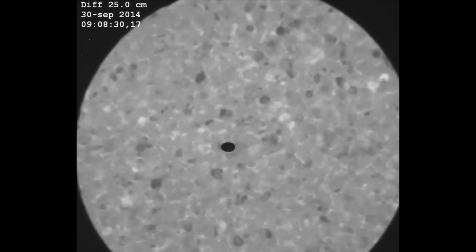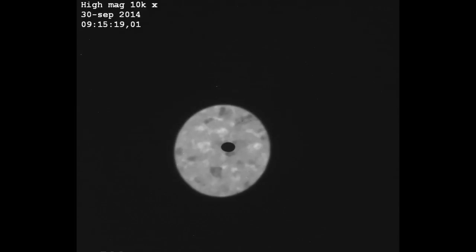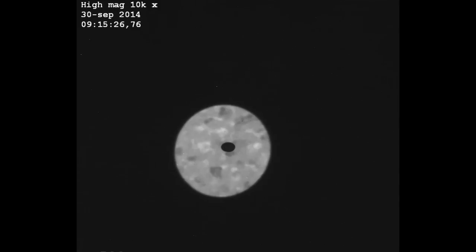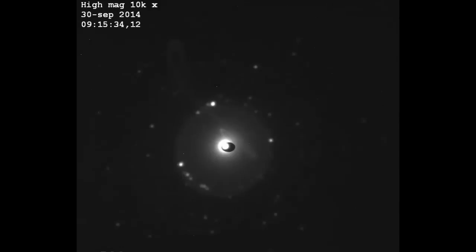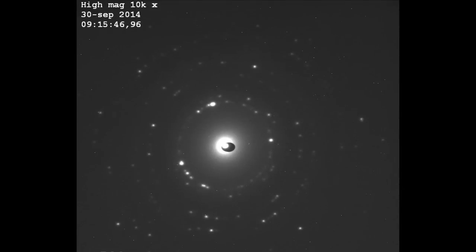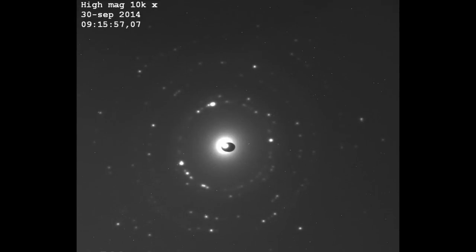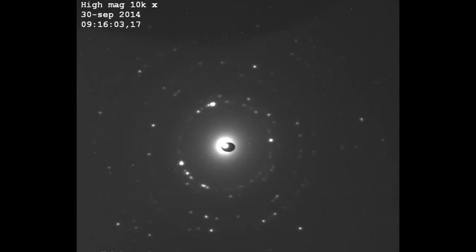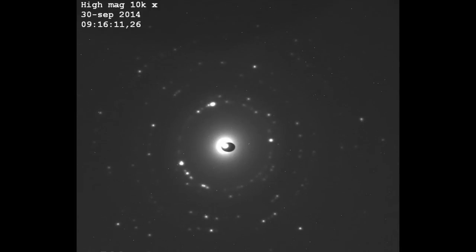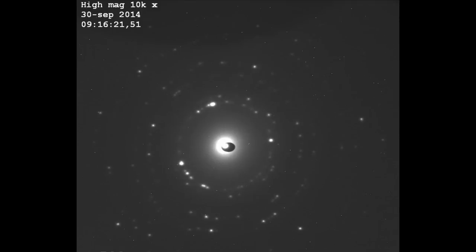We can try an even smaller aperture to increase this effect. Now I try the smallest aperture — the diameter of this disk is much much smaller than the last one, meaning we get very few crystals. You can almost count them in the image. The circles are almost barely visible now because so few crystals contribute, so we're approaching more and more towards a single crystal diffraction pattern. If the sample were amorphous instead, we wouldn't see any dots at all — just a blurred region in the center of the image. That's how you can determine if a sample is amorphous or crystalline.